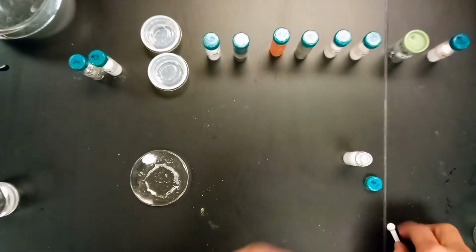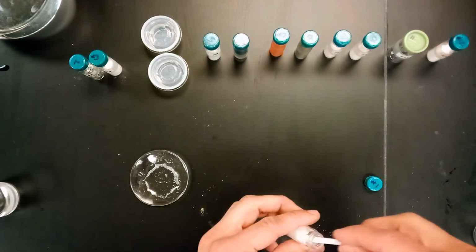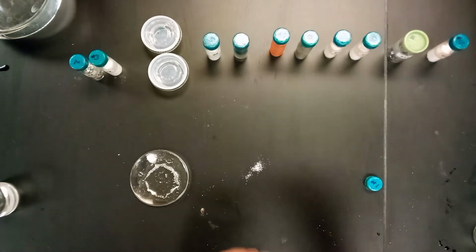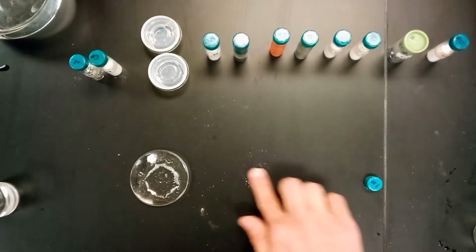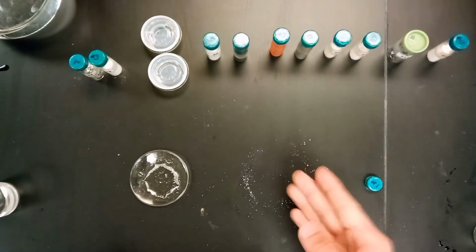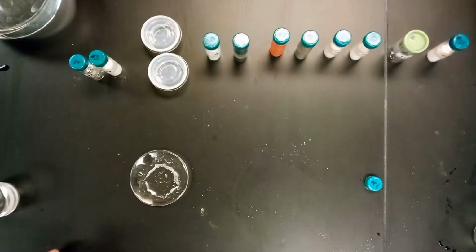And the second thing that we're going to try with this one is we're going to take a very small amount of it, put it on the black table, and see if you can write with it with your finger. There's no real residual being left on the table, so we could just clean that up a second.